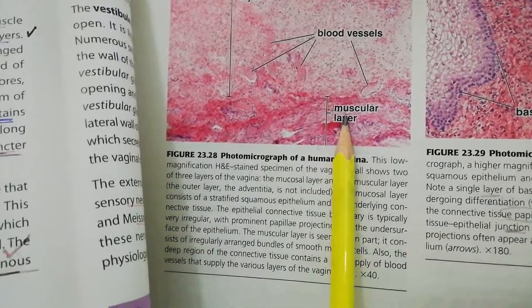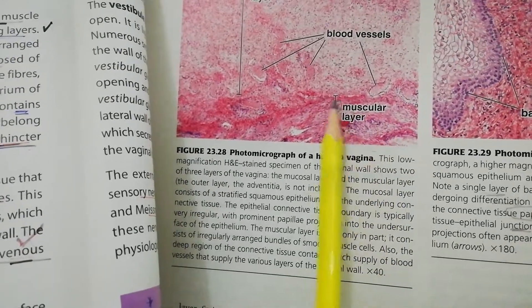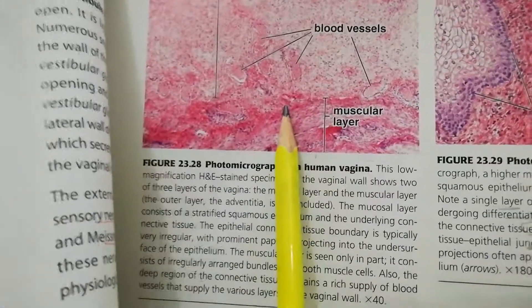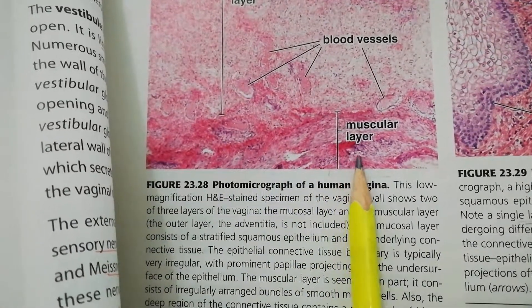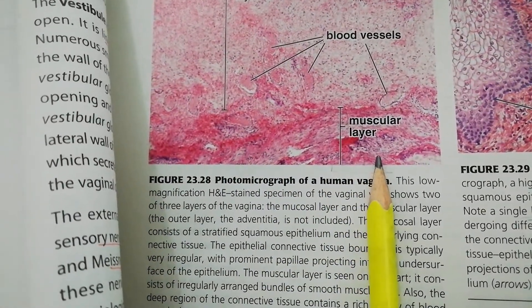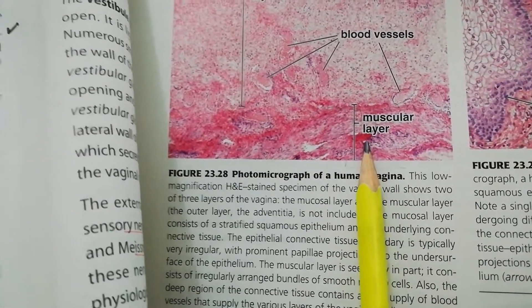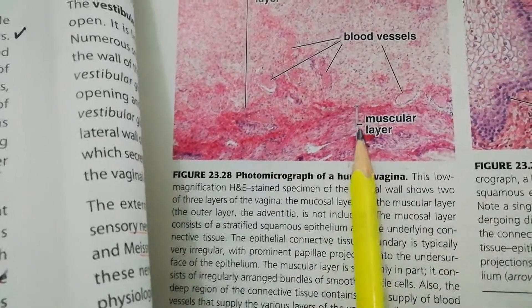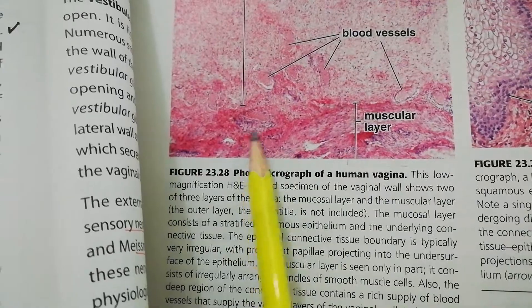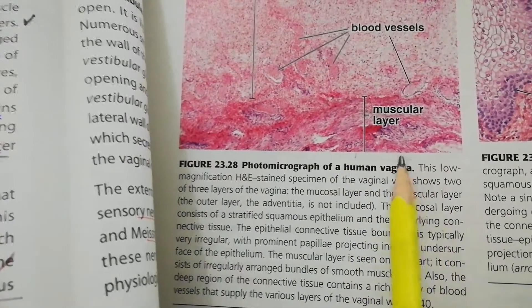Next comes the interwoven muscularis layer with smooth muscle arrangement. The smooth muscles are of two intermingling fiber types. The inner layer is composed of circularly arranged muscle fibers and the outer one is longitudinally arranged, but they are spirally intermingled, so we can hardly differentiate between the layers — you can just find them as a collection of bundles.